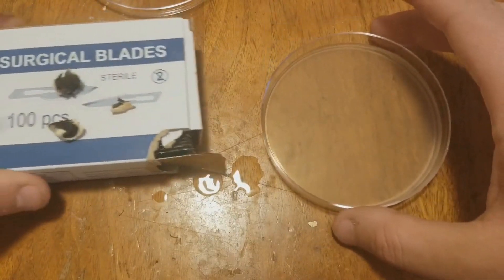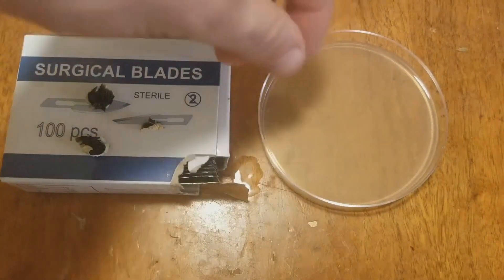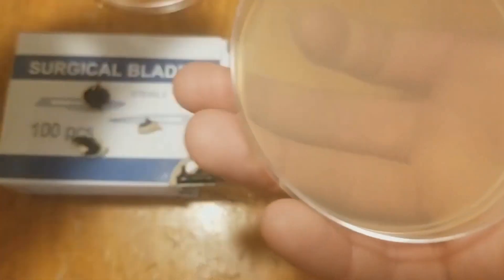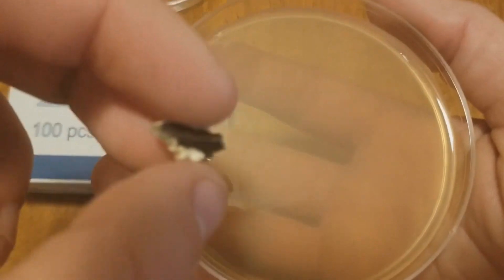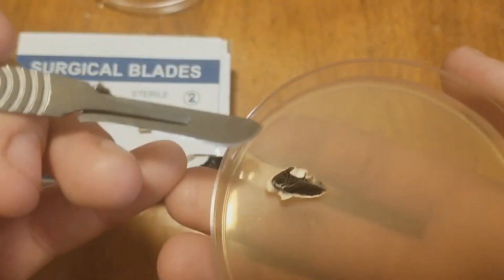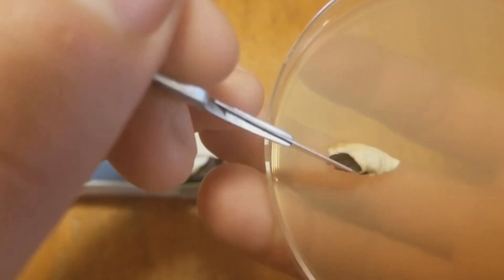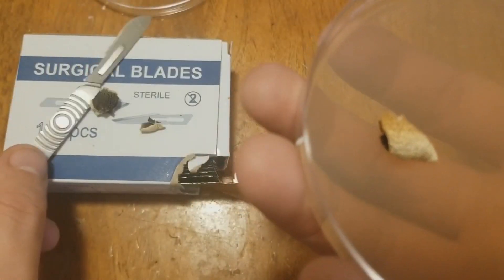Pull up our plate here and our gills — I've tried to chop them up. I recommend doing it in three pieces so that if you see any contamination starting to take place, you can just pull those and replace them, or just let the other ones grow out. I always do it in three. What I like to do is take these and throw the gill side face-down onto the plate. Of course it never works as you want it to, so you can take your scalpel and just flip them over. Try to face all the gills face down.